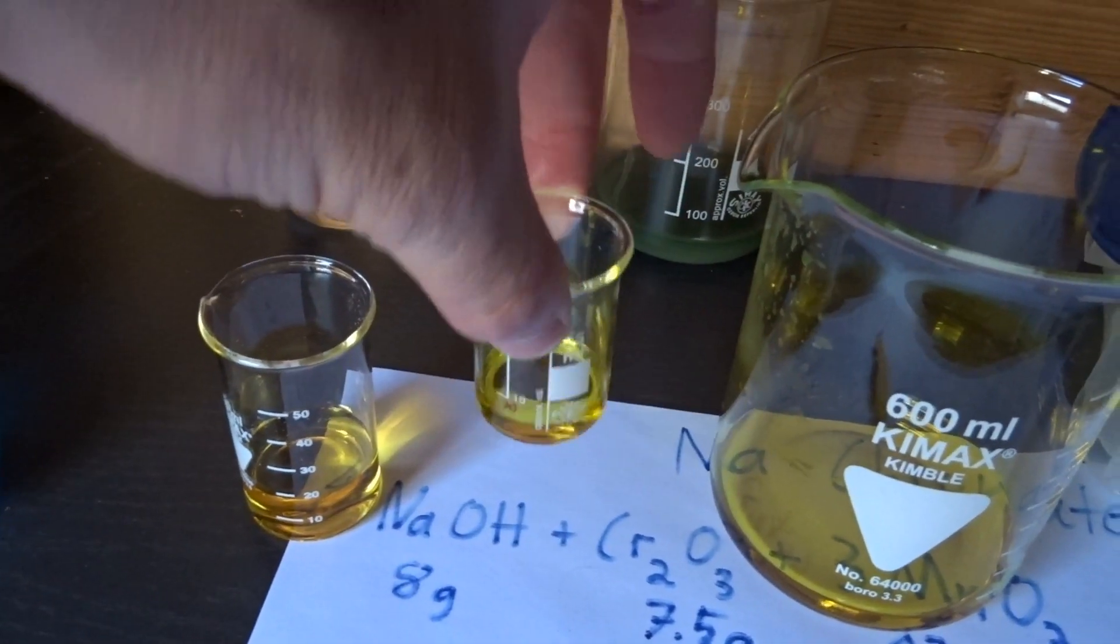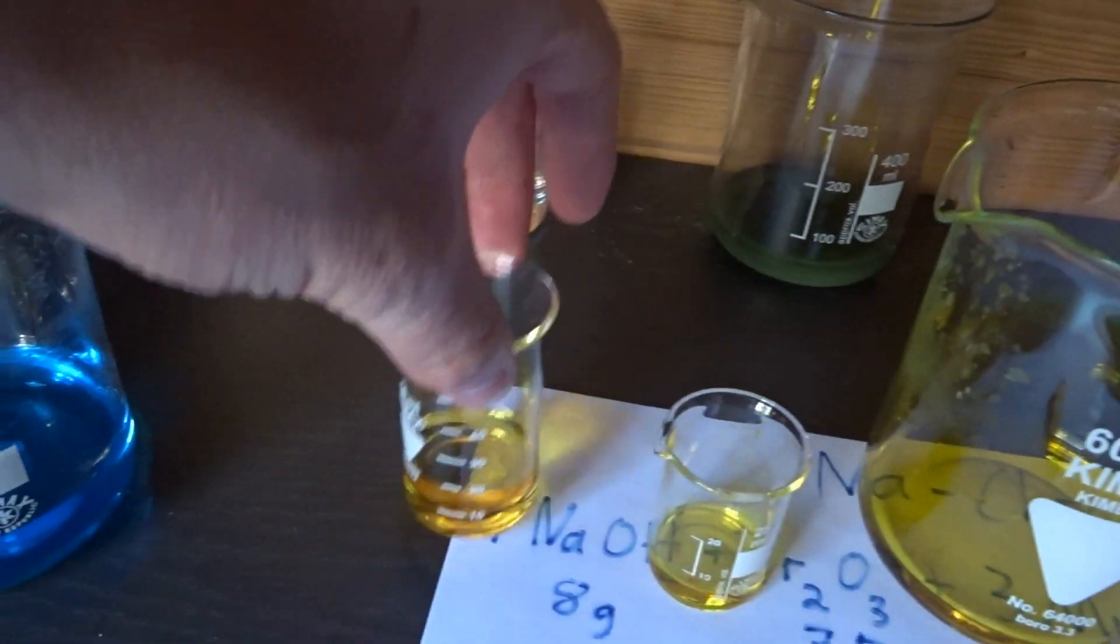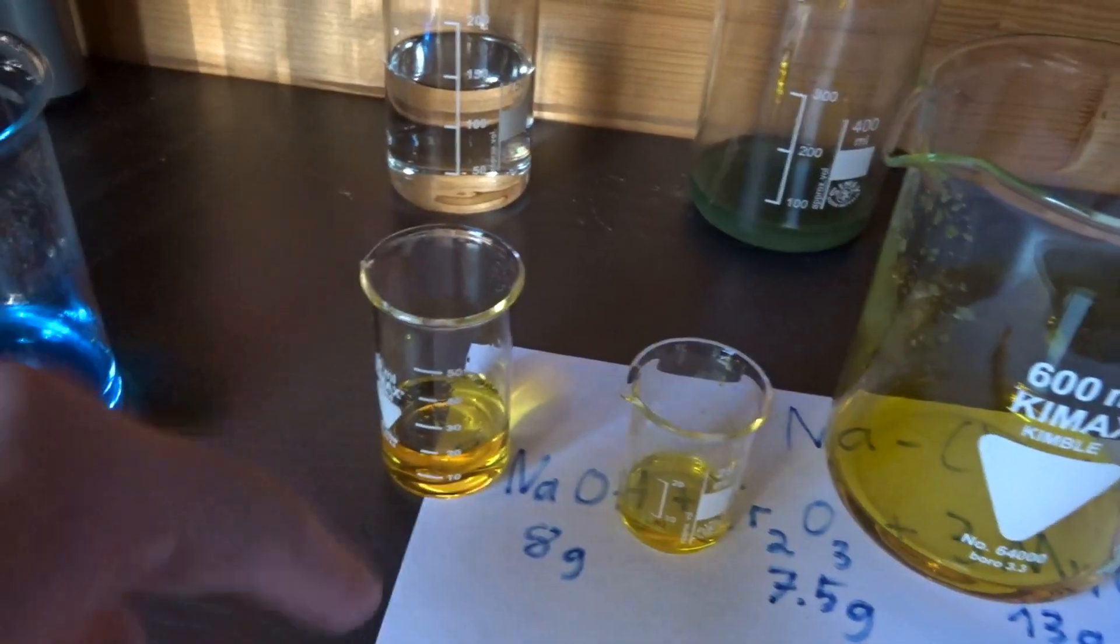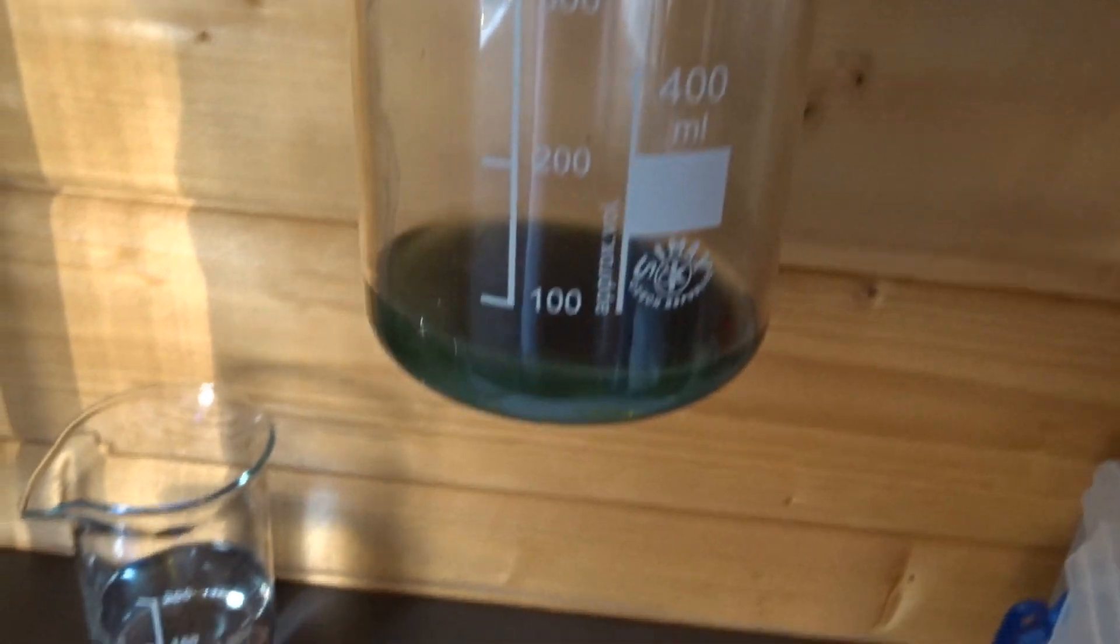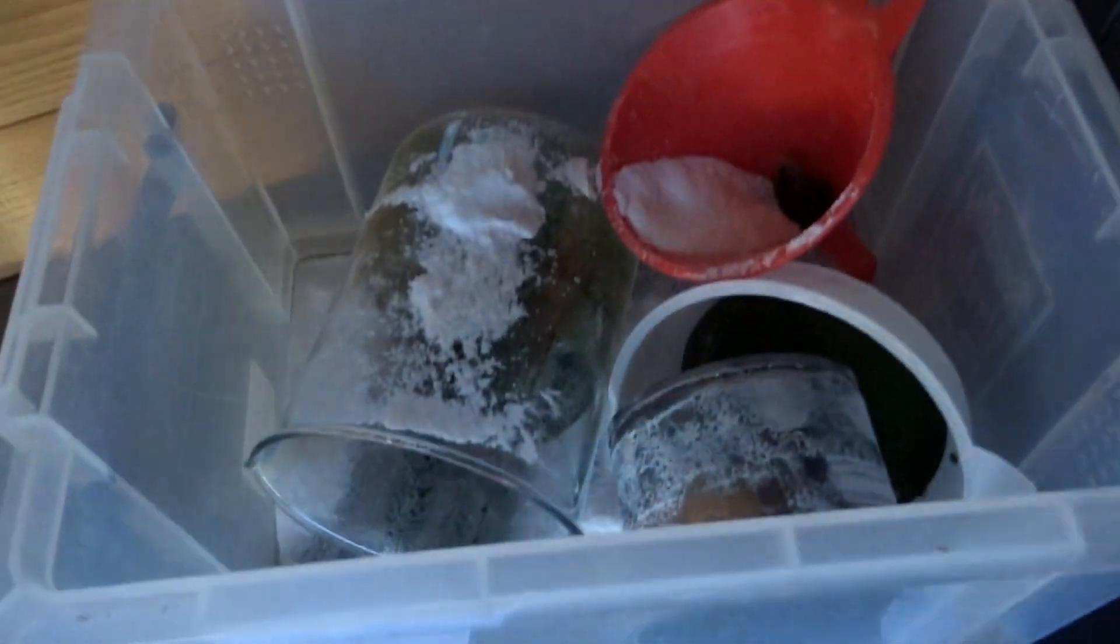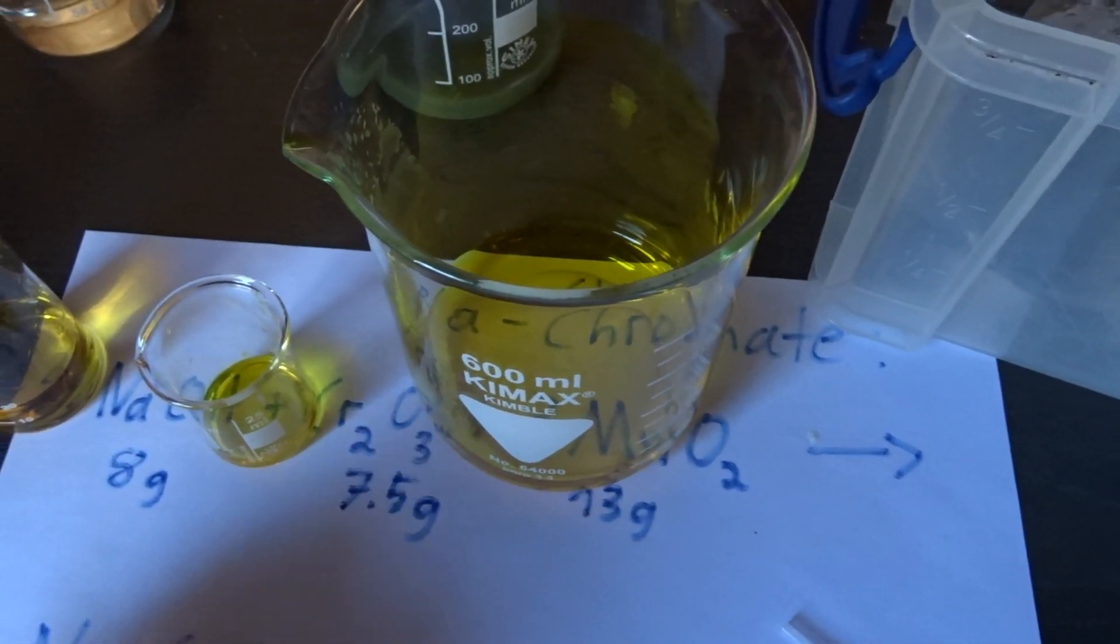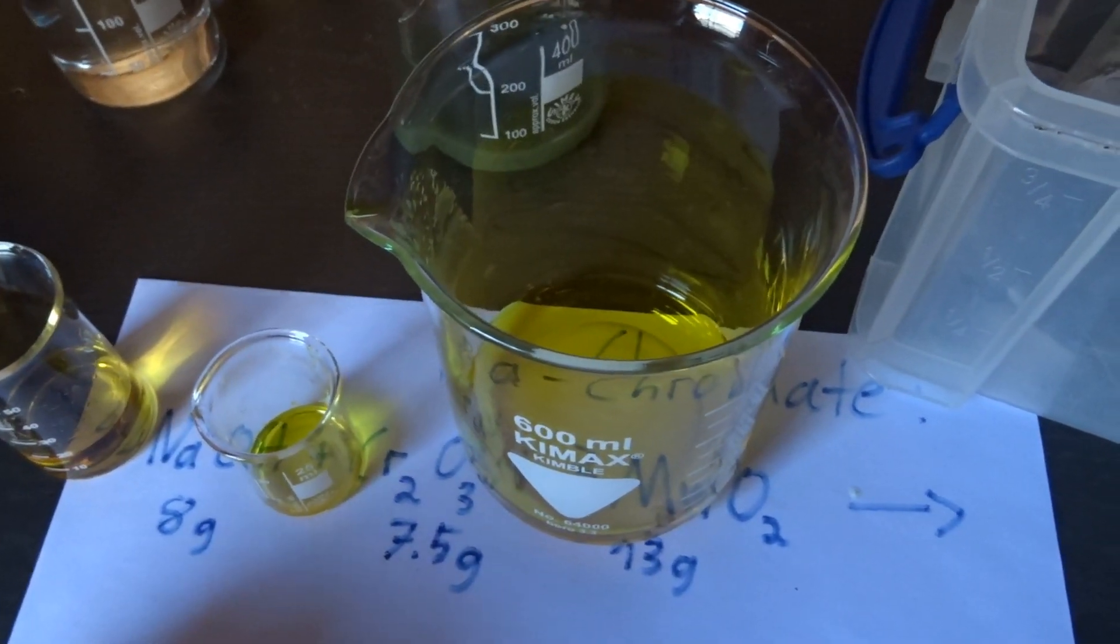Here is a little bit for testing. And that is some old acidified very dilute dichromate and some copper sulfate. Back there I have already neutralized a chromate solution. Well I have not neutralized it but really I neutralized and reduced it using vitamin C. And here you see all my equipment sprayed over with vitamin C made ready for reduction. Because chromium-6 is really nothing I want to let go into the environment. I really don't want to do that.